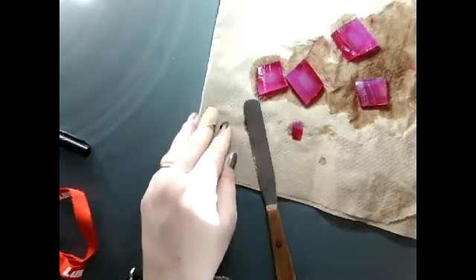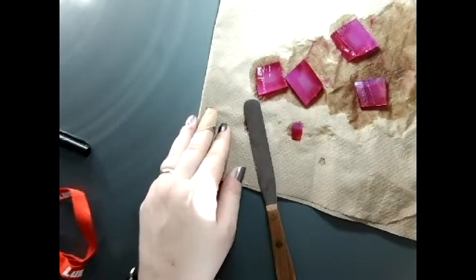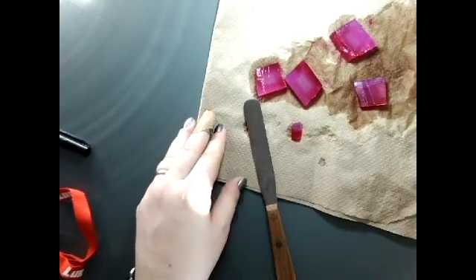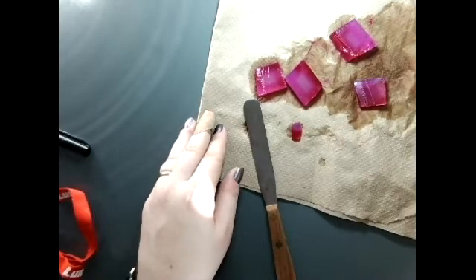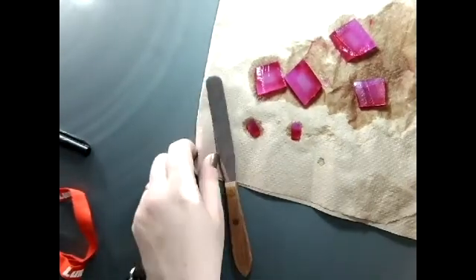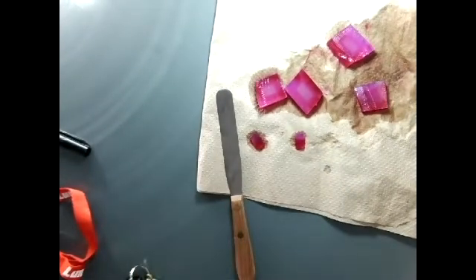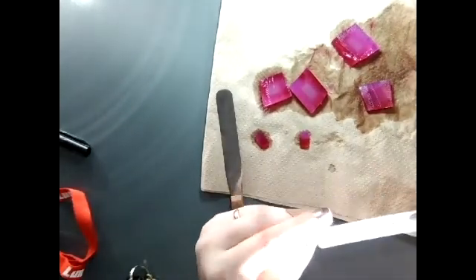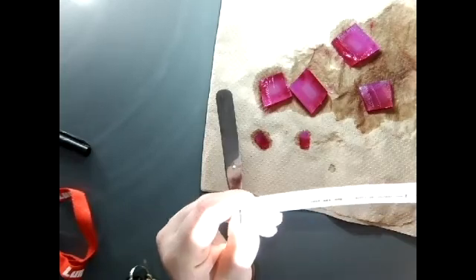I have taken these out of the sodium hydroxide solution, and I have cut them in half using a spatula. And what we're going to measure now is the depth of diffusion, and we're supposed to measure it in millimeters.